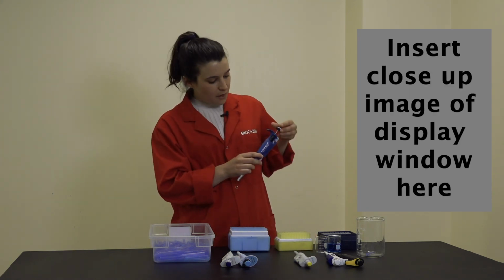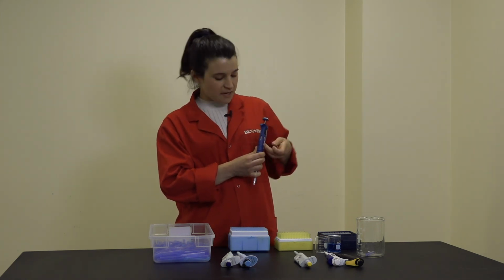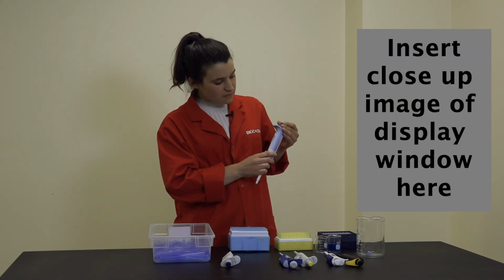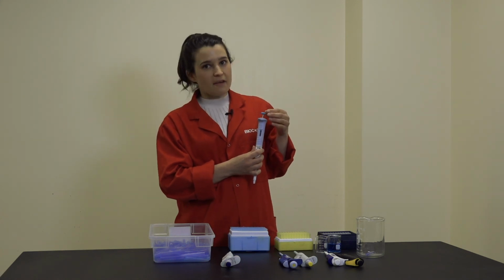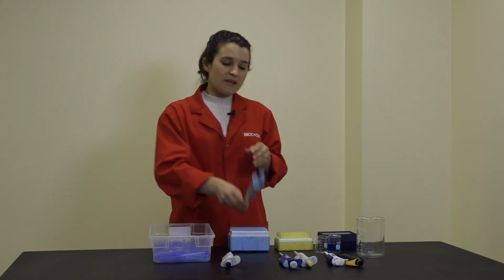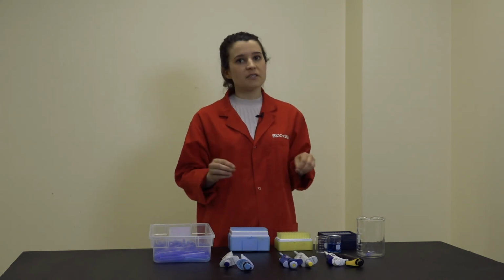Here's another P200, which in fact doesn't have numbers to indicate the first decimal place, but instead uses these markings along the bottom. Finally, we have a P1000, which goes up by increments of 5 microliters, and you use the markings along the bottom to select single microliter increments. As you can see, the different brands and different volumes can differ a little bit in terms of how they display the volume, so make sure you pay extra attention to this before you begin using your pipette.